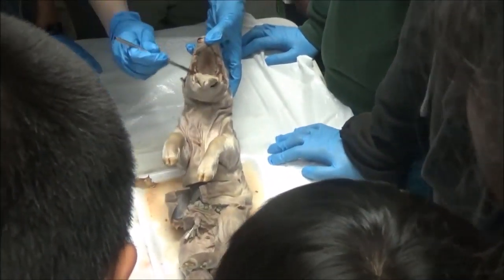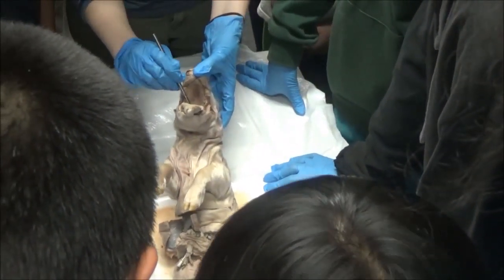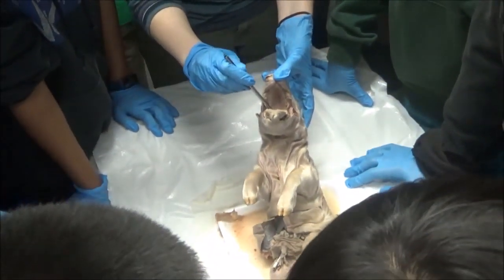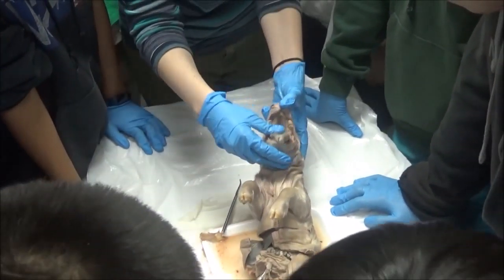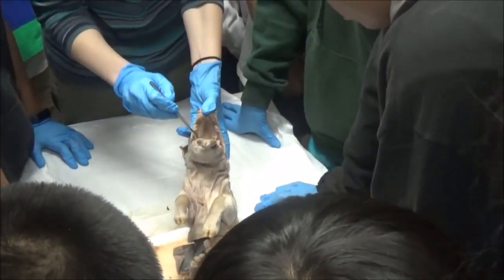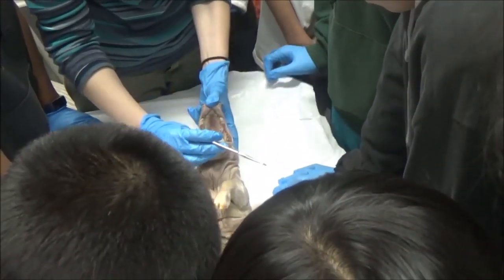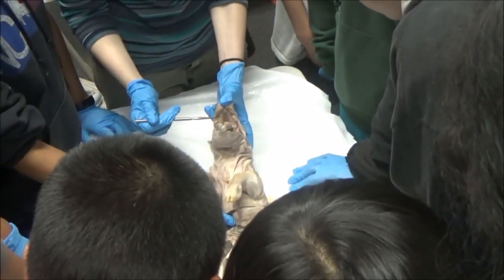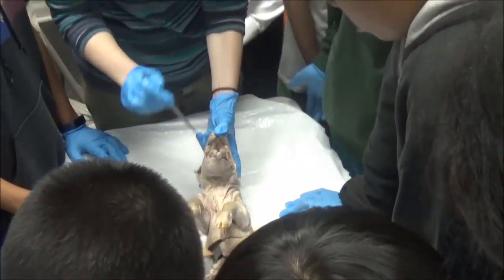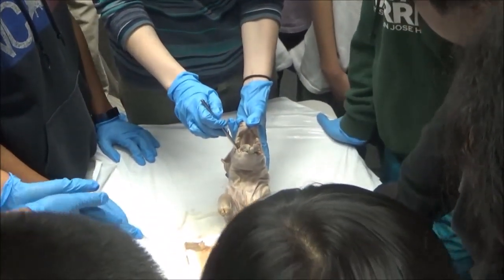If we look back here, we can actually poke down two separate holes. One hole is the trachea — how he breathes. The other hole is the esophagus — how he swallows food. The esophagus is going to connect all the way down to that stomach. The hole that's closer to the neck is the trachea; the hole that's further back is the esophagus.